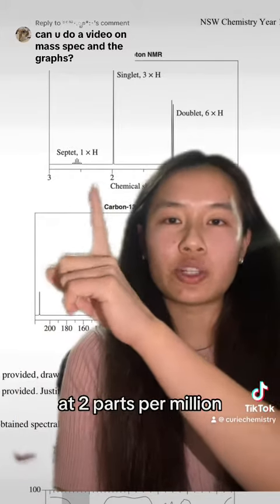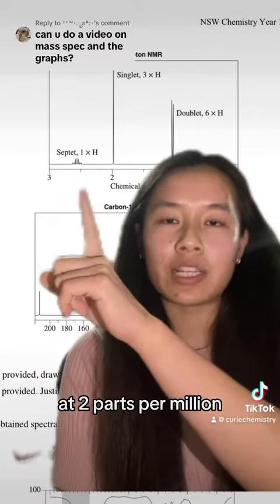This second peak at 2 parts per million, there's 3 hydrogens integrated and it's only a singlet, which means that it's probably a methyl group and it doesn't have any neighboring protons. That tells me that this is a methyl group that's directly bonded to the carbon-oxygen double bond because it doesn't have any neighboring hydrogens.